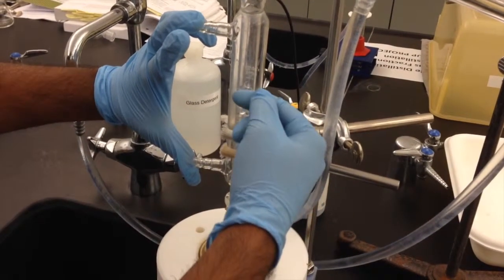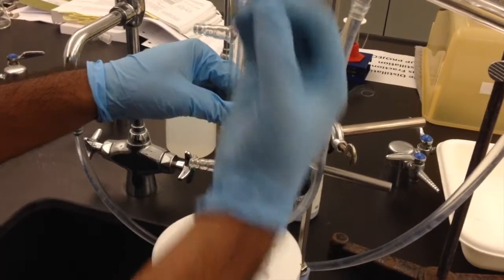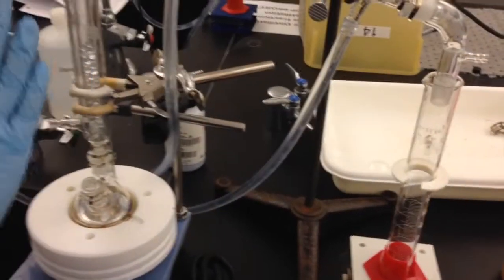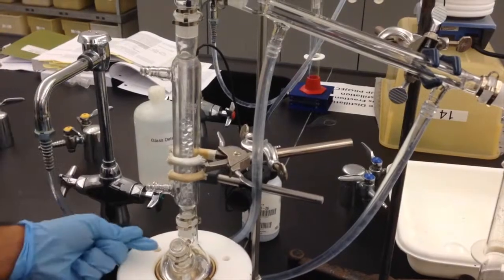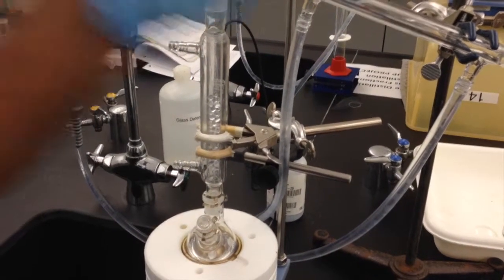But as it cools the beads down, it will send the higher boiling point toluene back into the bowl and let the cyclohexane evaporate through, go through the condensing tube and back into the graduated cylinder to collect it. Why this is more efficient than the simple distillation is because of these glass beads right here. When you have a simple distillation setup, when it evaporates, it's technically one plate. It evaporates up, goes through the tube, and comes back down.